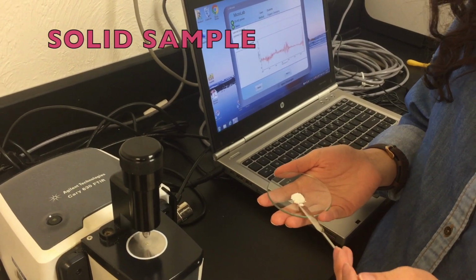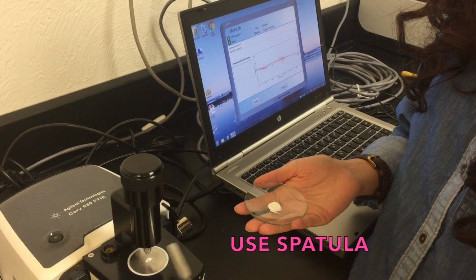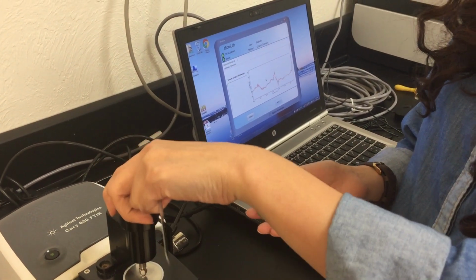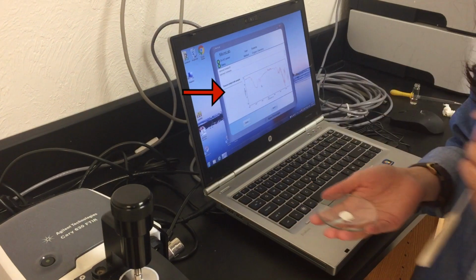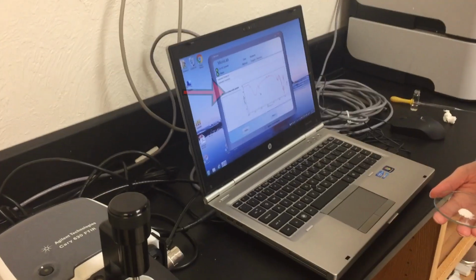When you have a solid sample, use a spatula and place just a few pieces of the sample to cover the iris. Then screw down the pin until you hear the click. Again, notice that the spectrum on the screen changes when you screw down the pin.